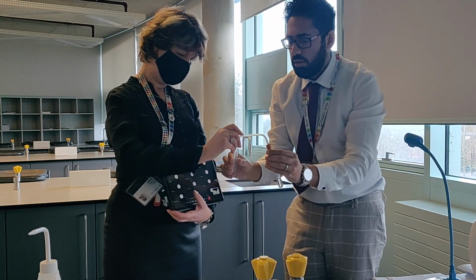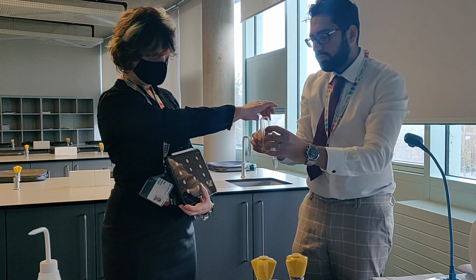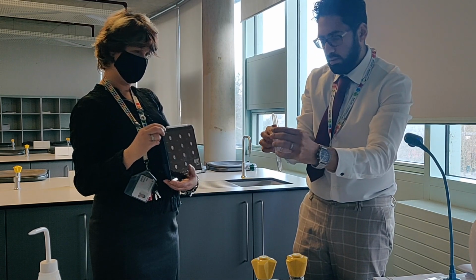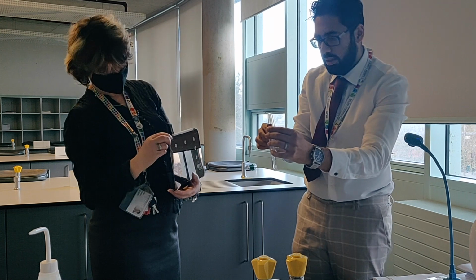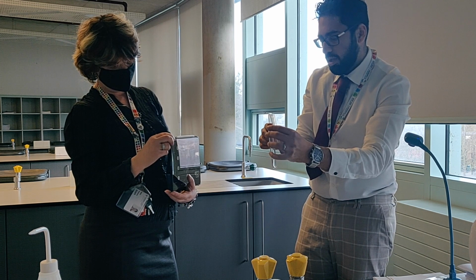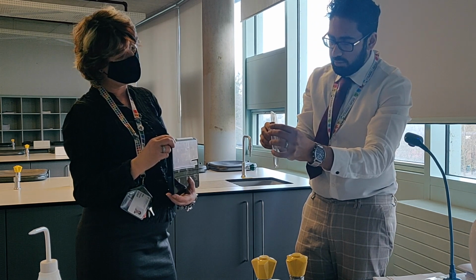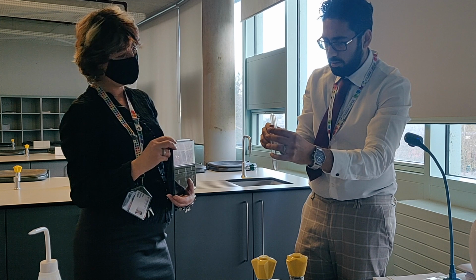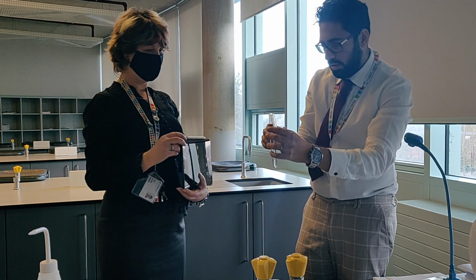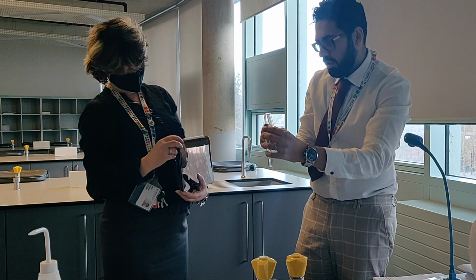Okay. Right, so on my delivery tube, you can see that the lime water should begin to start turning cloudy, because these two are reacting and carbon dioxide is being produced. It did show a few bubbles. There were definitely bubbles there, which means that carbon dioxide was present.